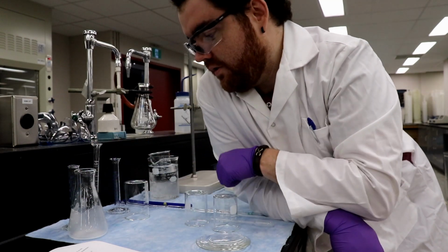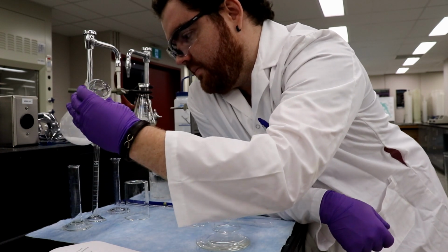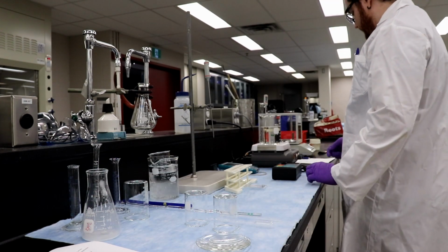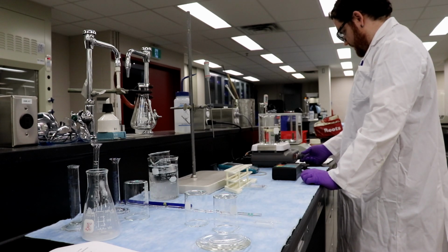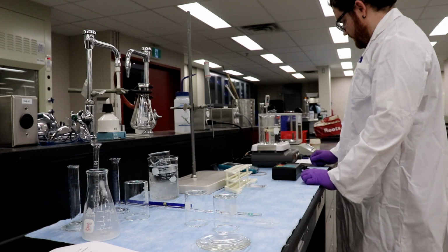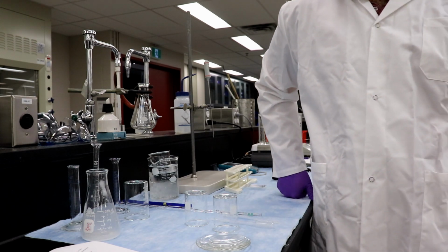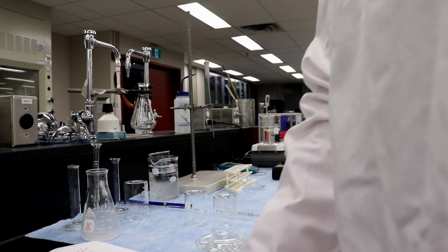I'm not going to put my head right over the beaker of reacting salicylic acid. I'll do that math right now. So water bath wise, 48. Sorry, I did have it going. No, you're good. Don't worry. The oven's on too. Perfect. It's amazing how much stayed on there, eh? 4.9291 grams SA in reaction.